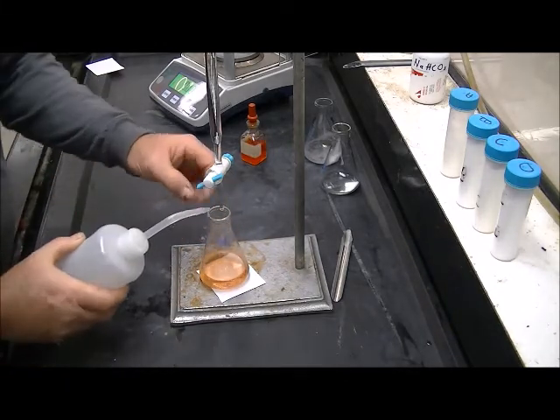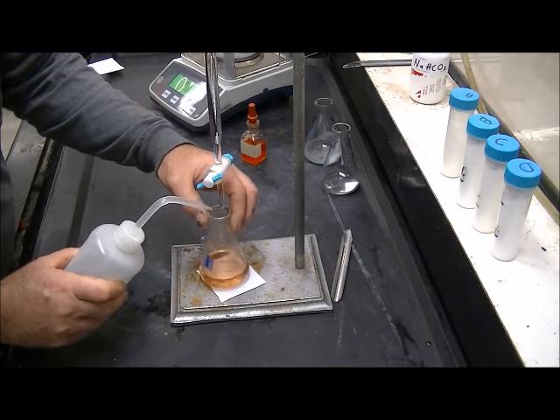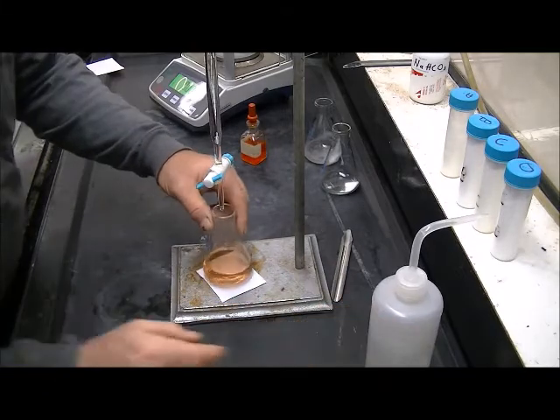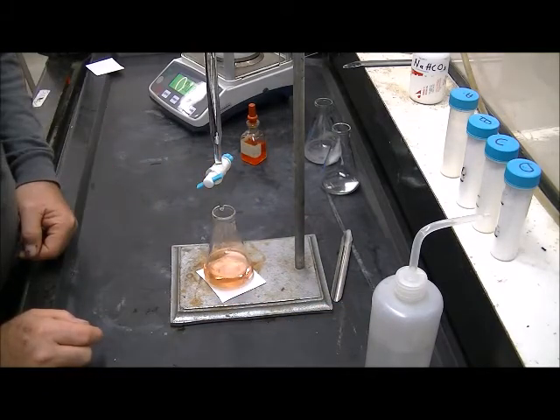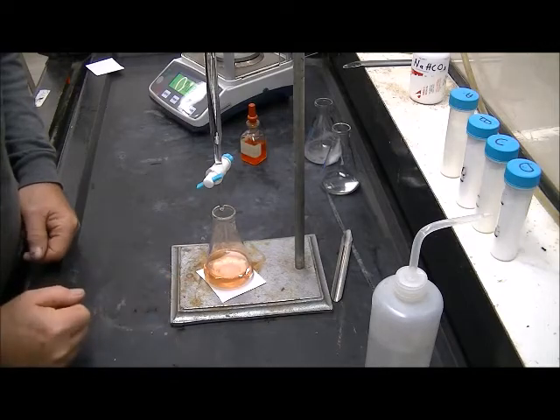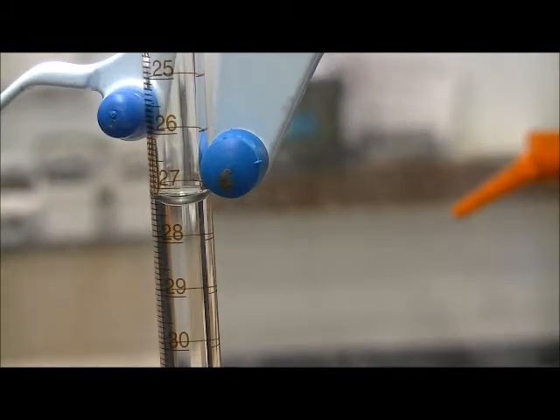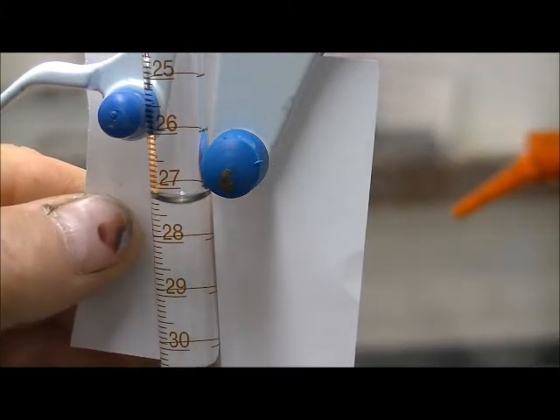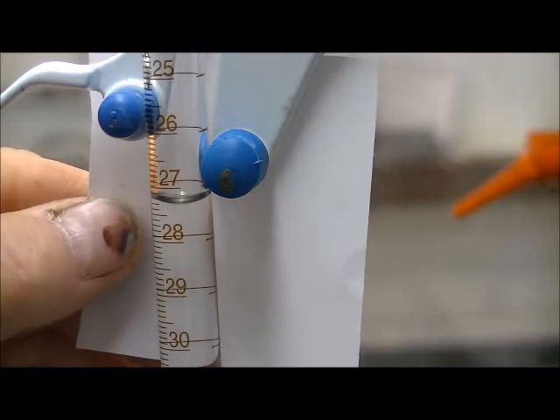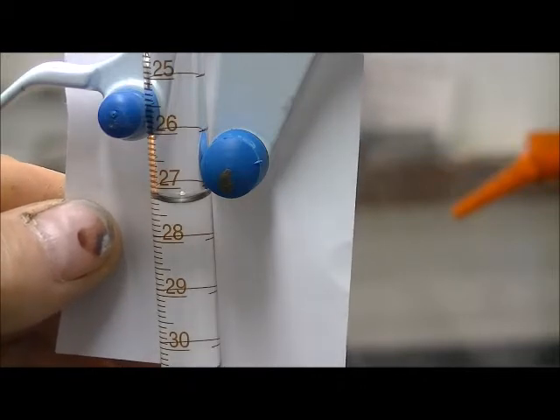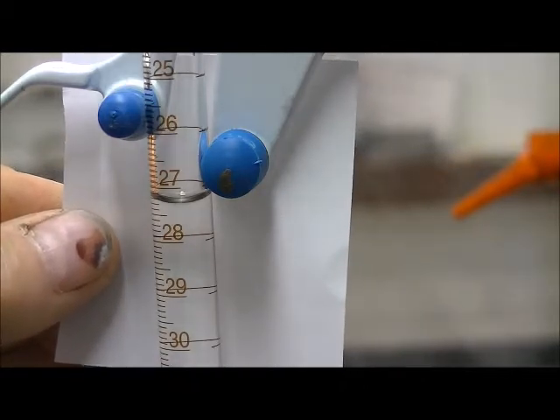I like it right there. I'm going to rinse down any spatter up here that may contain unreacted sodium bicarbonate. Just to make sure. And yes, that color right there is my end point. Again, using my little piece of white paper to help me distinguish the numbers there. It looks like I am below 27 by three little marks. So it is 27.3 milliliters that we used.